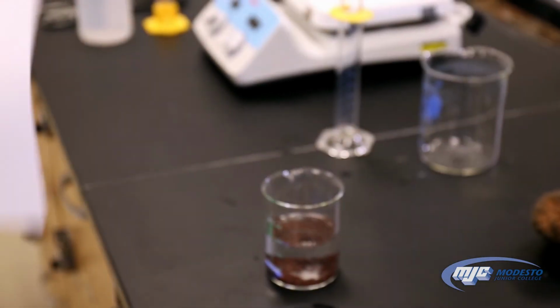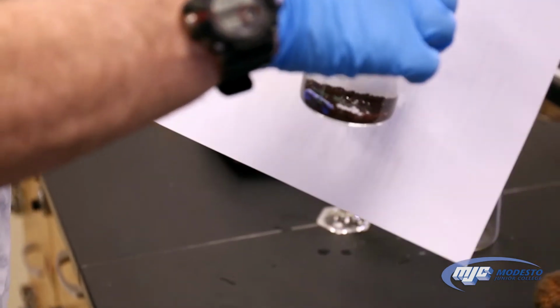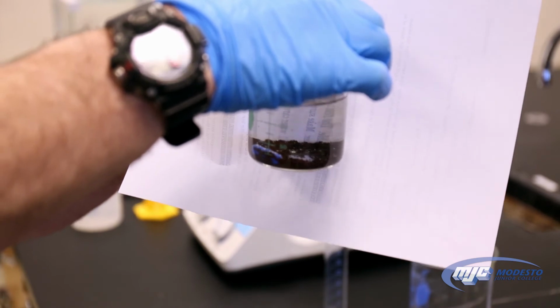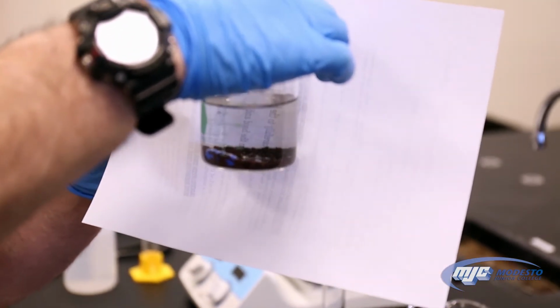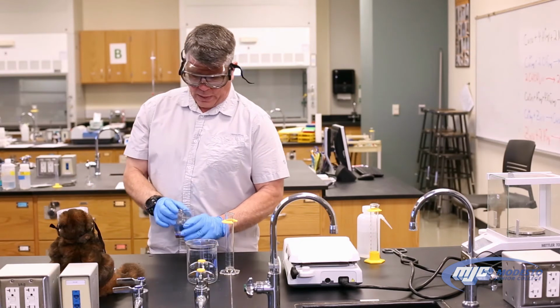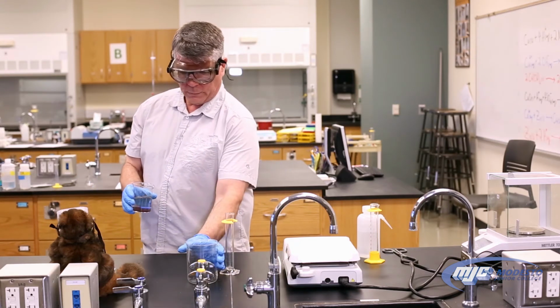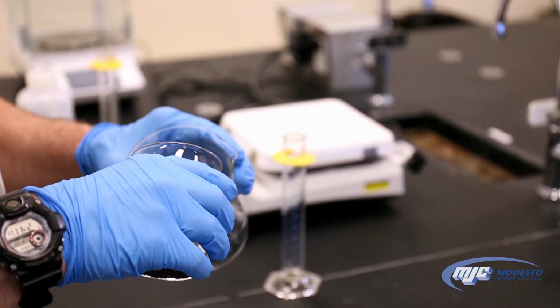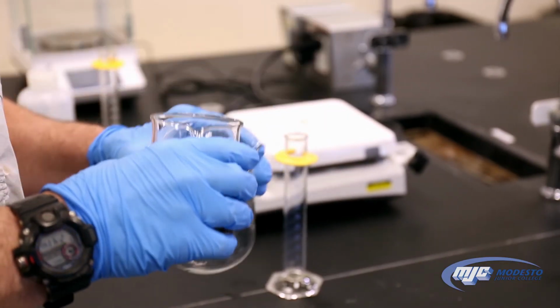All right, guys, so now we know that the reaction has finished. All of the copper 2 ions have been converted into copper metal, that brown stuff at the bottom, because there is no blue in the solution. It's pretty good. We've got all the blue out. So now we're going to decant the liquid off the top. Try not to let any of the copper get transferred over. This is our waste beaker still.